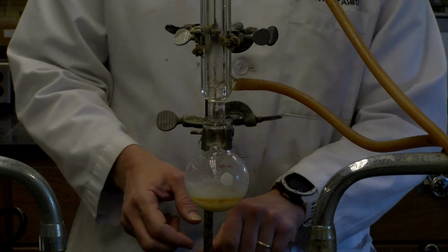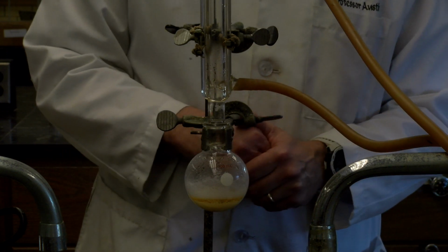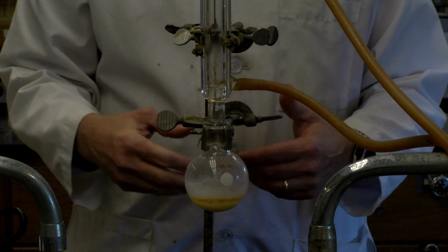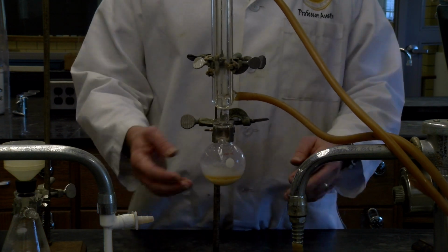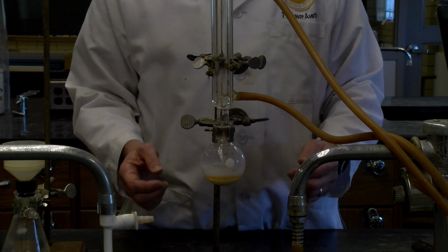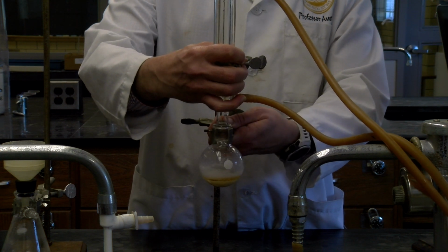So we're going to wait just a little bit to make sure that all the fumaric acid forms and crystallizes here. And then we're going to collect it and then recrystallize it, that is, more purify it. All right, so we'll be back in just a second to show that. All right, so we finished heating this, and I feel that more fumaric acid is actually solidifying here. So what we can do is go ahead and separate these.